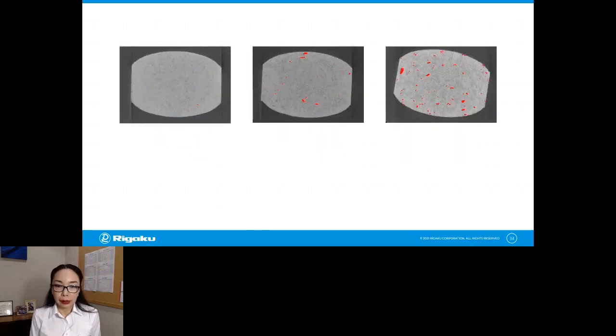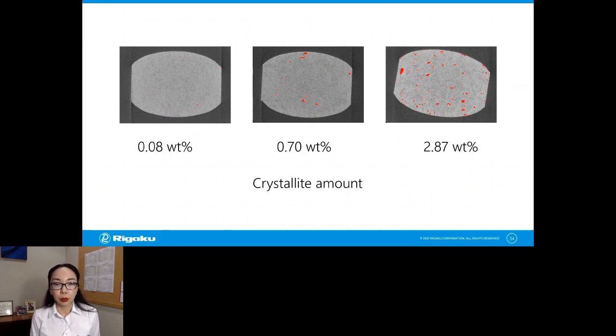When you see them, you can segment them as highlighted red in those cross sections, then go on to quantify them. Now, using X-ray CT, not only can you quantify how much crystalline API you have in tablets, you also know where they are and how their grains look. For example, you can tell the difference between crystallization happening, let's say, on the surface of the tablet where it's exposed to humidity, or crystallization starting from seed crystals that already existed in the original tablet. You can tell the difference between those two.